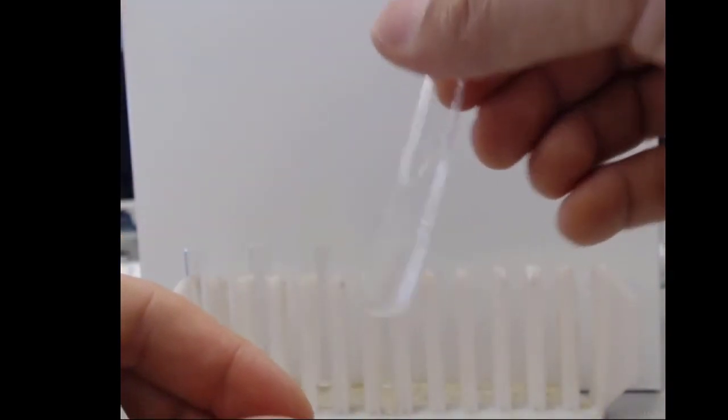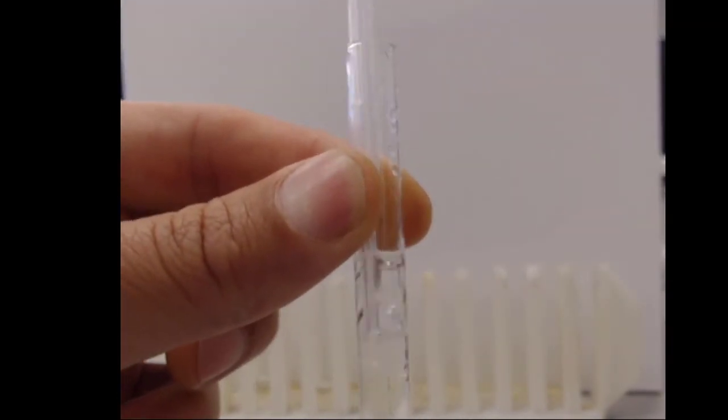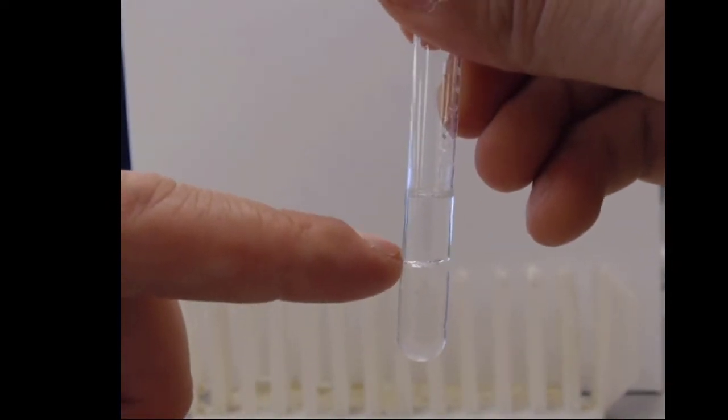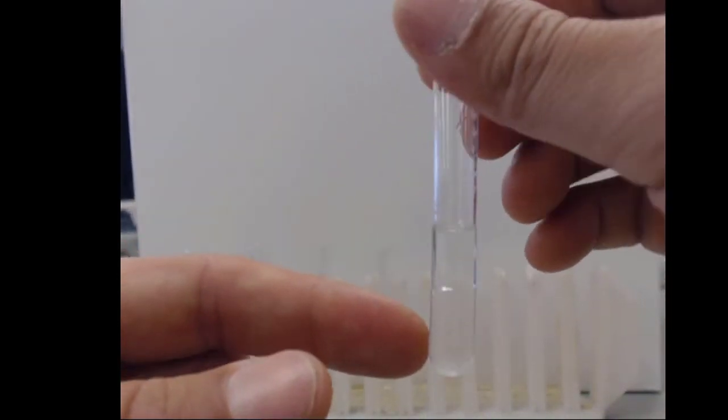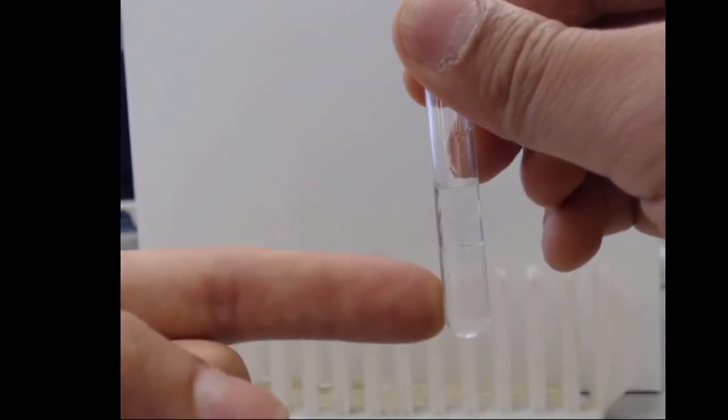We add in some water. Ooh, that was a lot of water. So in this situation, we can go ahead and try to disturb it more. In this situation, you'll notice we still end up with two distinct layers. So even though we added a functional group to our hexane and turned it into hexanol, it still separates out. So the interactions of the water with itself are stronger than the interactions of the water with the hexanol. So that creates this separation.